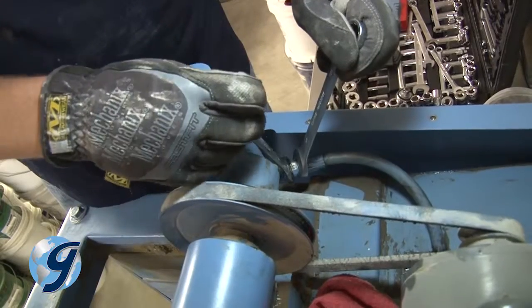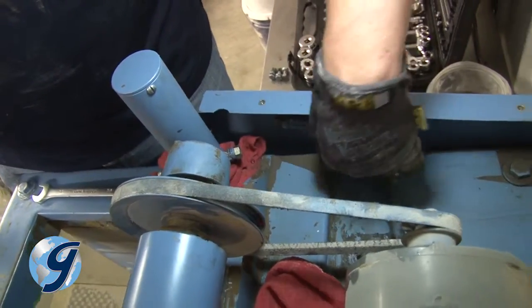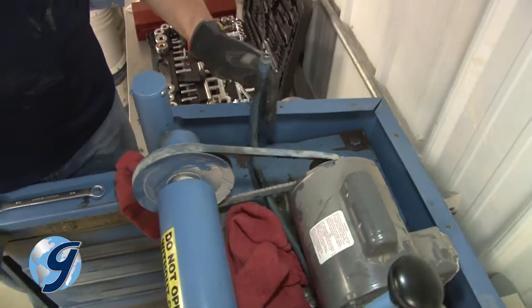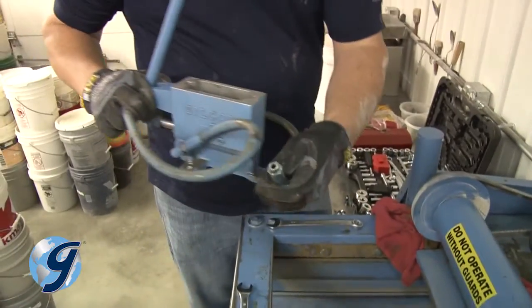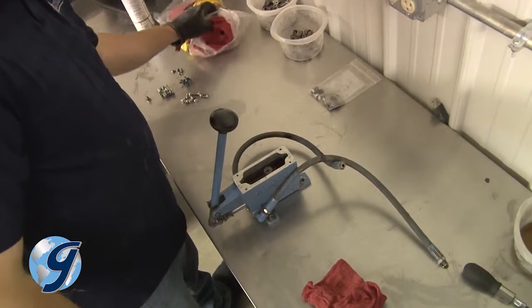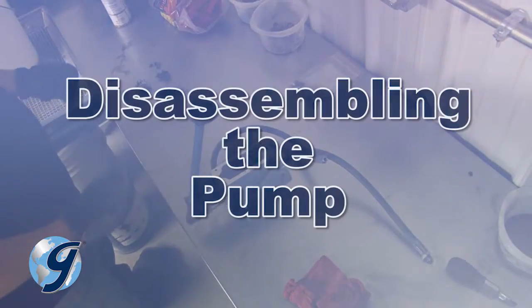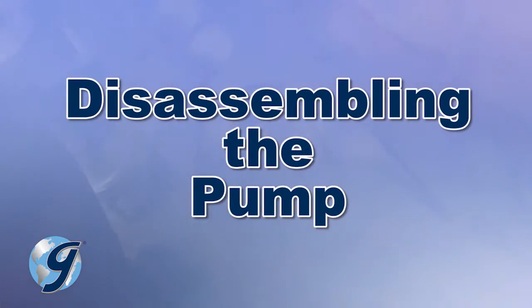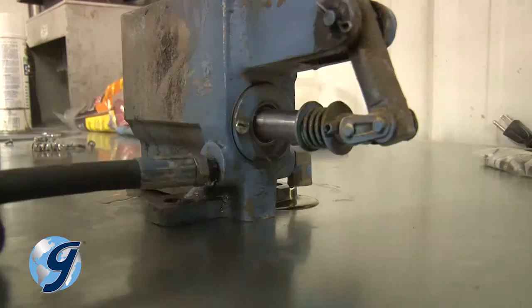Now, disconnect the hydraulic hose fittings at the cylinders. Make sure that you have rags in place to minimize spillage of hydraulic fluid. Once the hydraulic lines have been removed, move the pump and hoses to a workbench or other solid clean area for further disassembly. Now, remove the hydraulic lines from the pump.